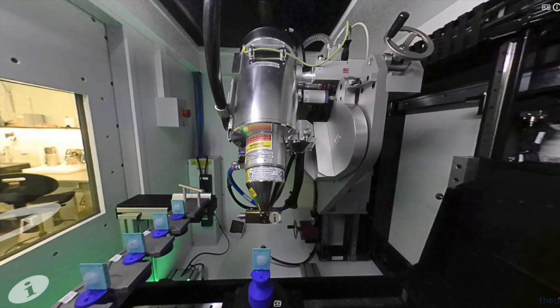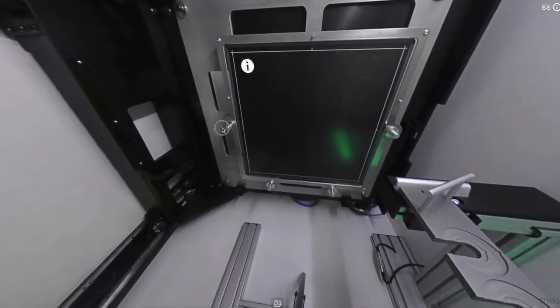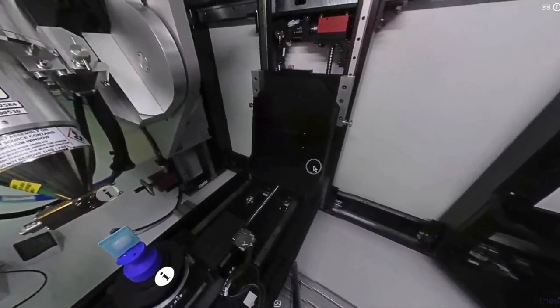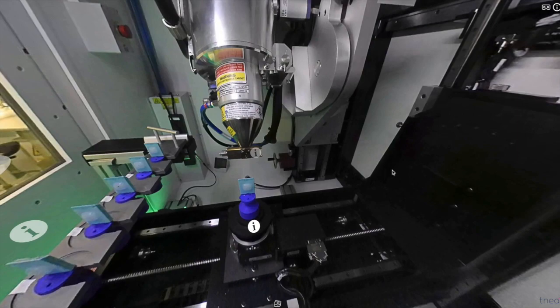In real life, the inside of a micro-CT scanner looks something like this. In one side of the enclosure, you will find the X-ray source, that's where the X-rays are being generated, and on the opposite side of the enclosure, we have the X-ray detector. That's our X-ray camera where the radiographs are being captured. Between the two components, we have our rotating stage. That's where the specimen is being positioned and is rotated during the acquisition.